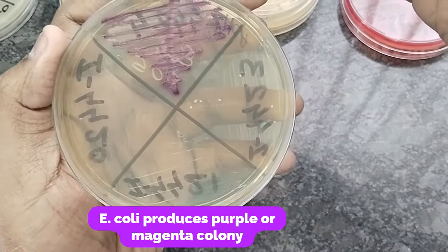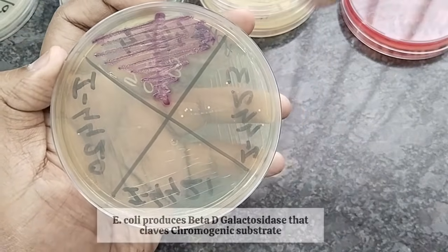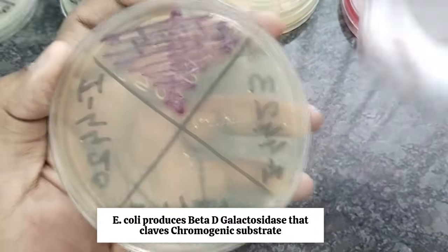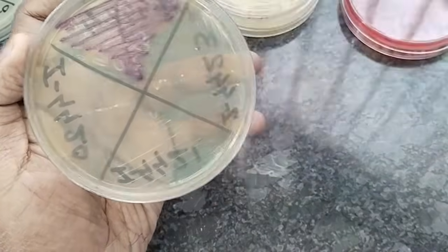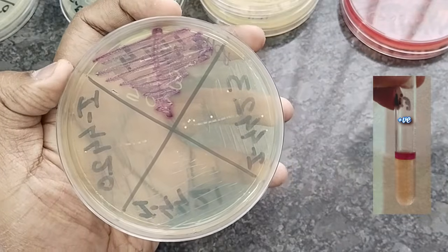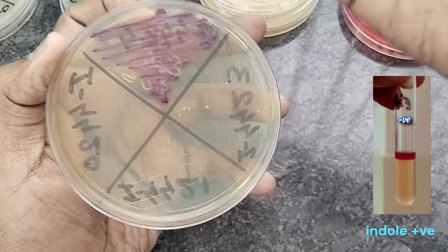Actually, E.coli produces beta D galactosidase. This beta D galactosidase can cleave the chromogenic agent and produce this magenta or purple color colony. Further, to confirm the bacteria, we can do the indole test. If indole is positive, then the bacteria is 100% E.coli.